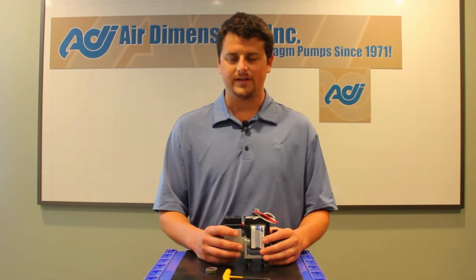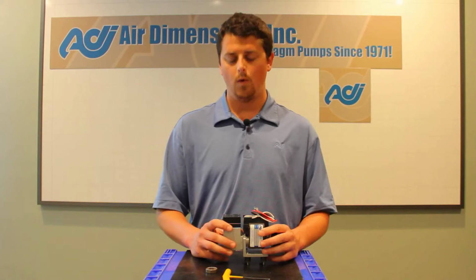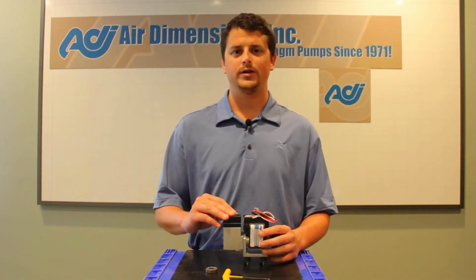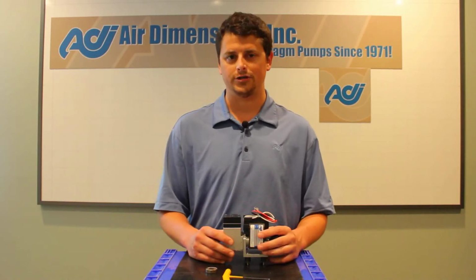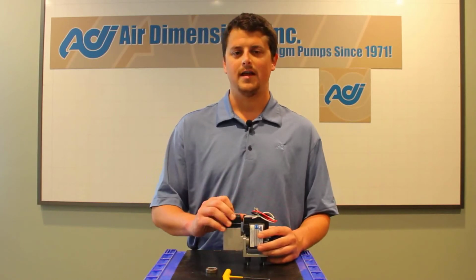www.airdimensions.com, you can see the max flow, pressure, and vacuum. In this case, we have a B161, so you should get around 7 liters per minute open flow, about 22 inches of mercury ultimate vacuum, and about 30 psi-G as ultimate pressure. And you know that if your pump is achieving those marks, that you've done the install correct and the pump is ready to go.